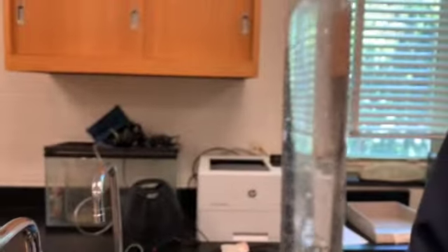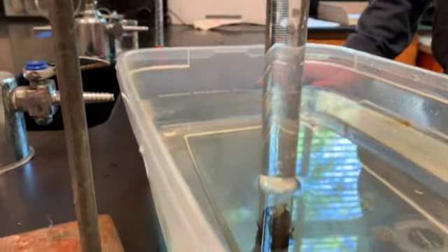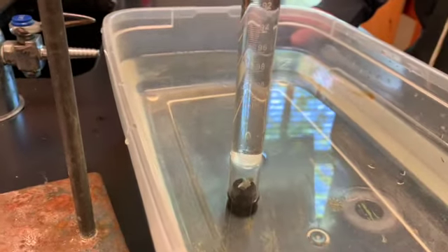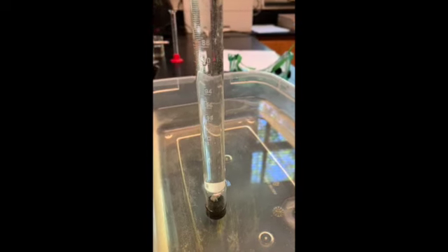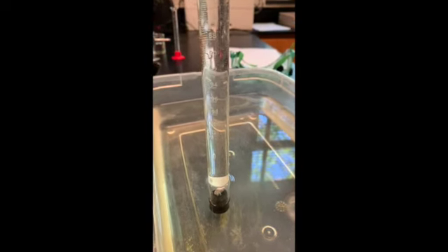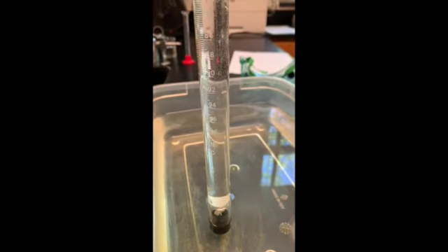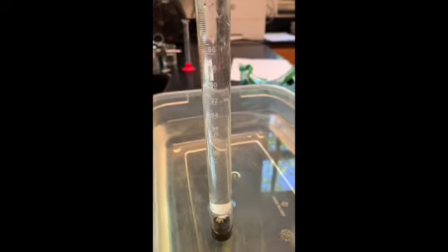And we just want to note, while Maurice has the paper up, this is how the gas collecting tube works. This is going to tell us exactly how much gas we end up producing. So I think our acid is still working its way down. All right, we're going to come back in a couple minutes and show you the gas that is produced. All right, so this is going to take several minutes, but I just wanted you to see that gas being produced. You can see it bubbling and it is being collected in the top of the tube.